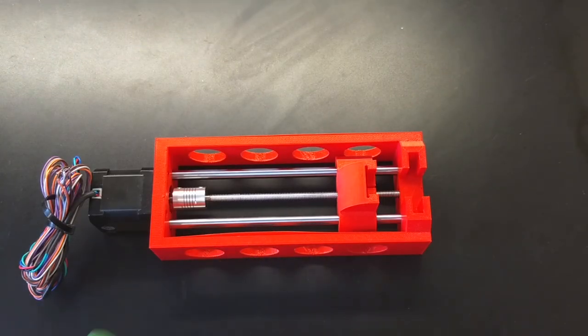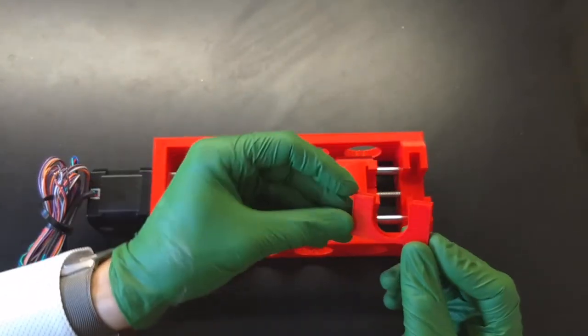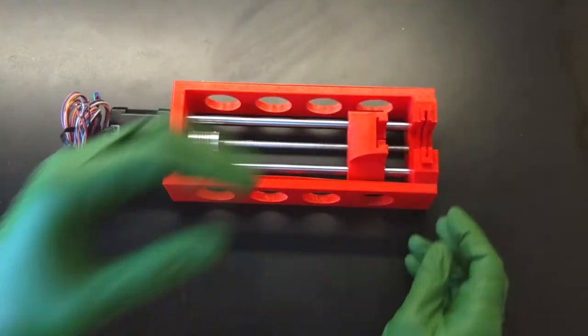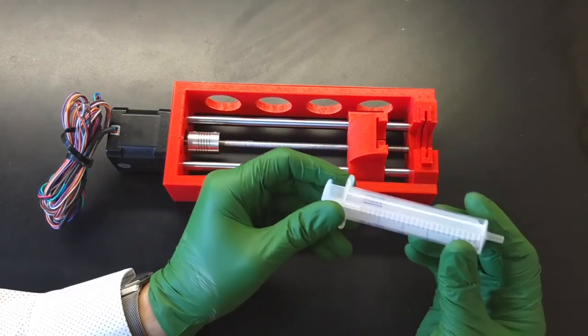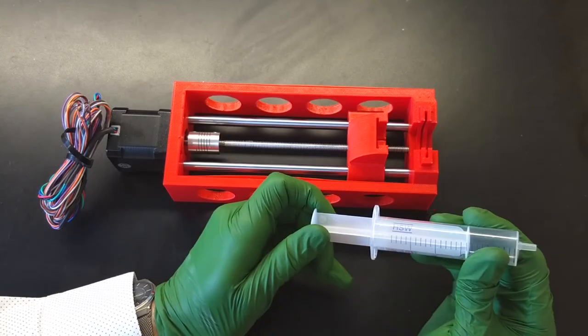It's almost done. Now get the syringe adapter and place the flat side into the notch at the front of the pump. It's now ready to fit the proper size syringe.